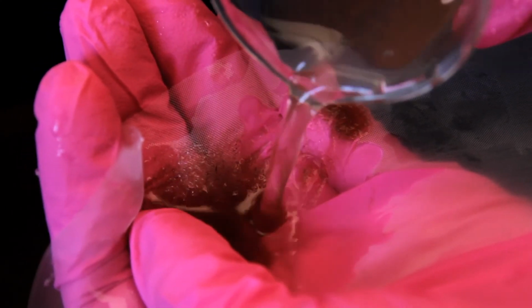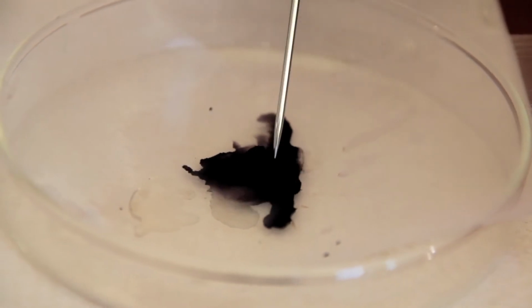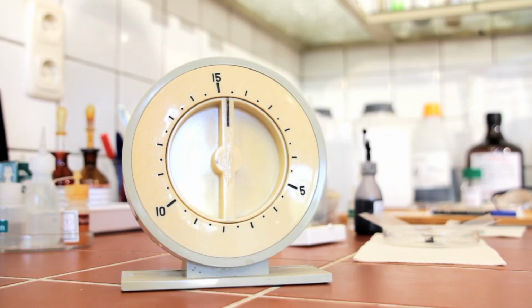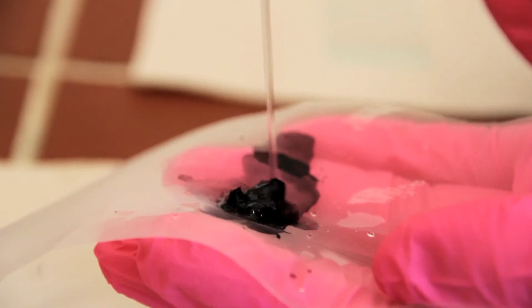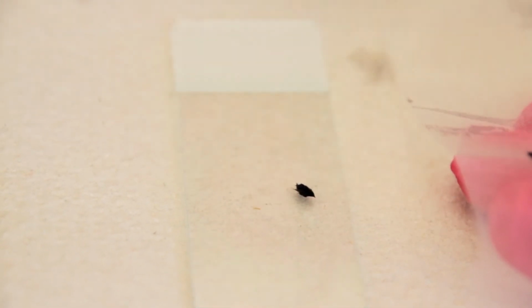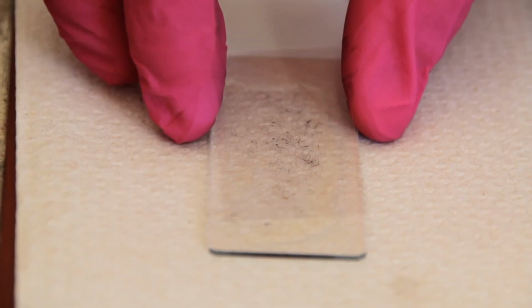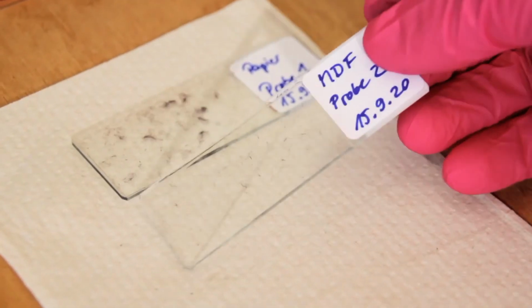At the sink, the fibers are filtered out and rinsed under tap water. The fibers are placed on the filter and stained with nigrosine for about 10 minutes. Then they are rinsed and evenly distributed on the surface of 2 to 3 microscope slides. For embedding, 4 to 5 drops of glycerin are dripped onto them and a cover glass is placed on top. The labeled sticker is stuck on and the slide can be examined under a light microscope.